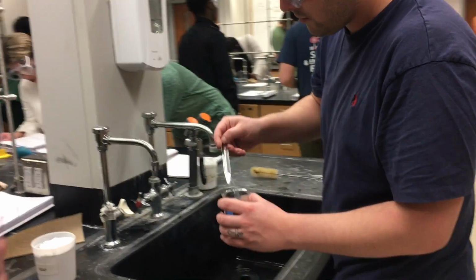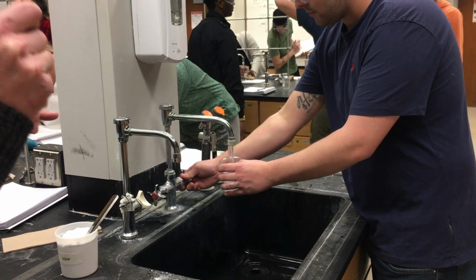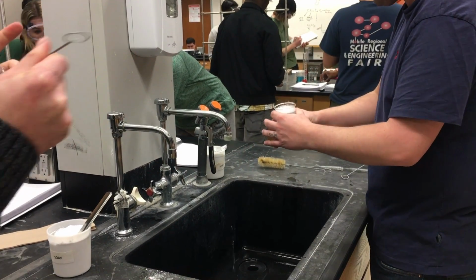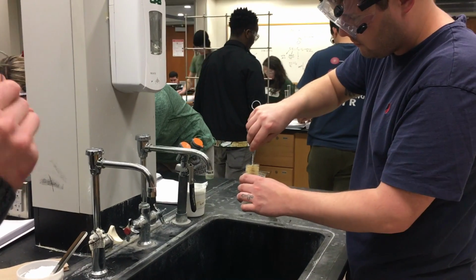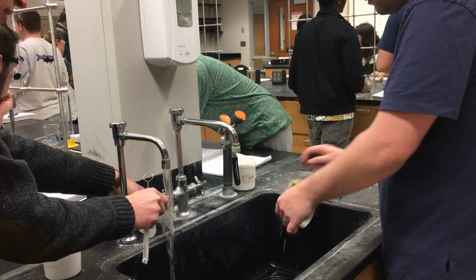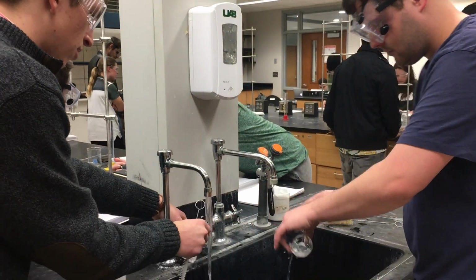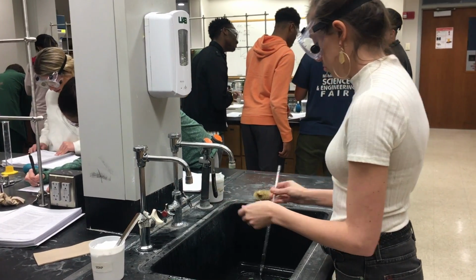Now that we have collected our data and finished our calculations, the most important thing is to clean up after the lab. All the glassware must be soaked, rinsed, dried, and put away. Here, Alan, Austin, and Cece clean up, content that they have knowledge to make a dilution.